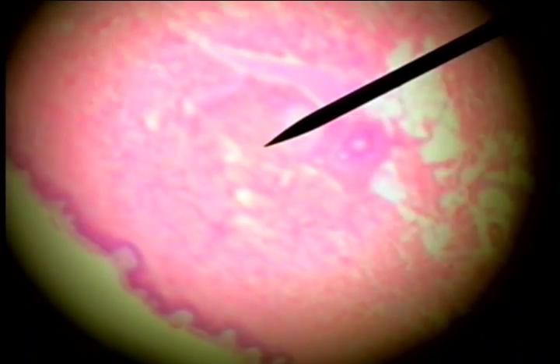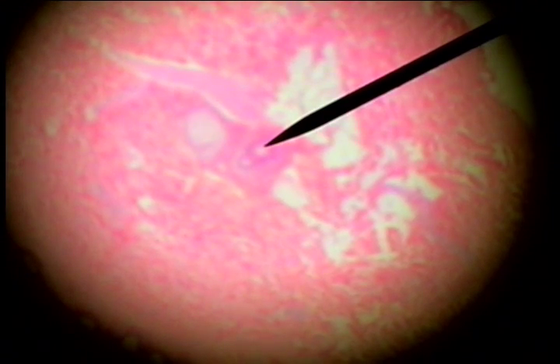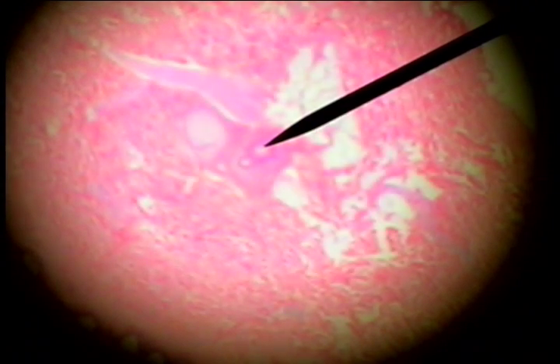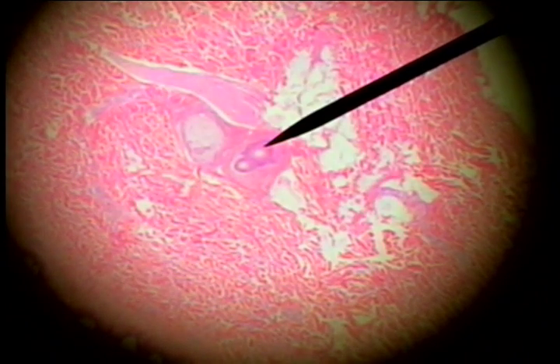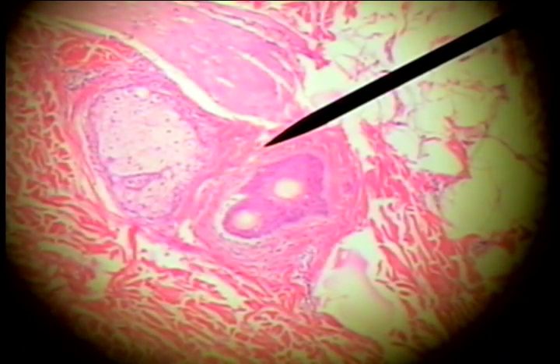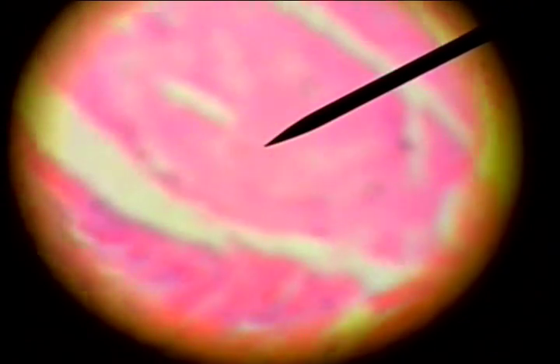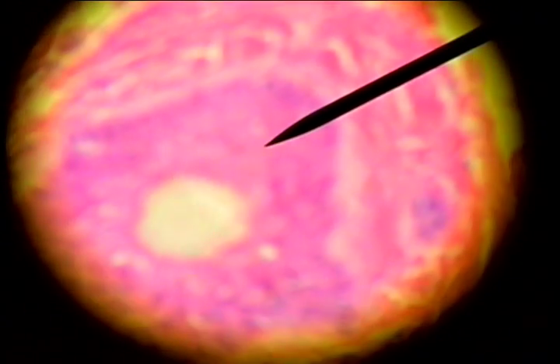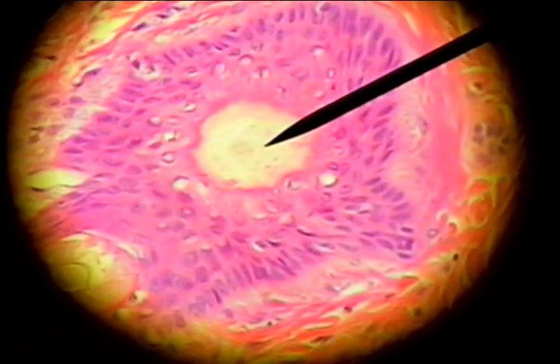Looking in the dermis, we can find in thin skin a hair follicle. Here's the hair follicle — the follicular cells here, and in the center the hair shaft itself. There are the follicular cells and the hair shaft itself.